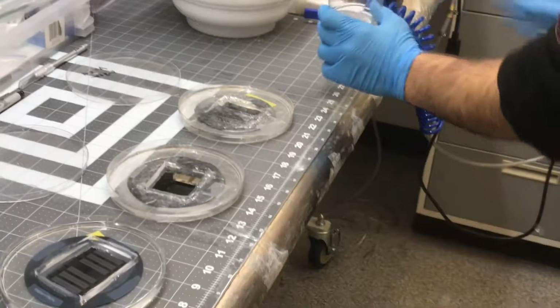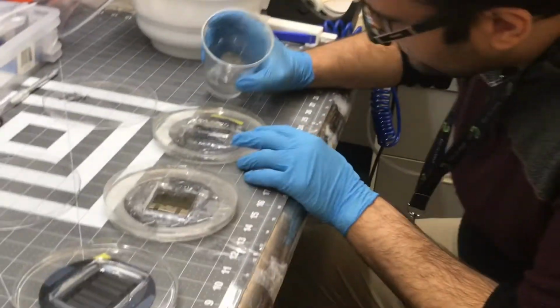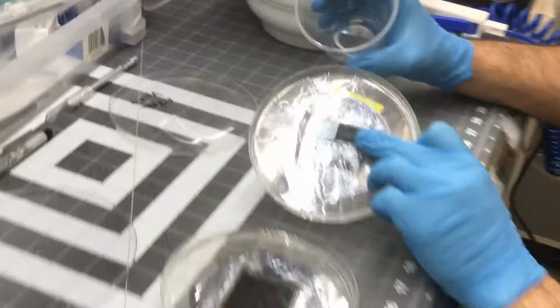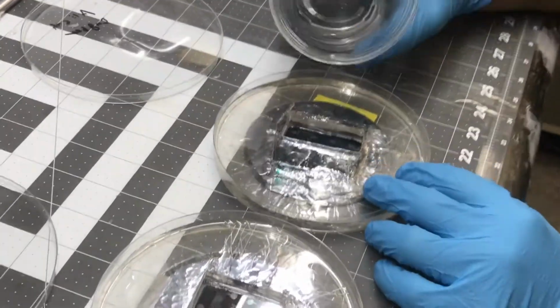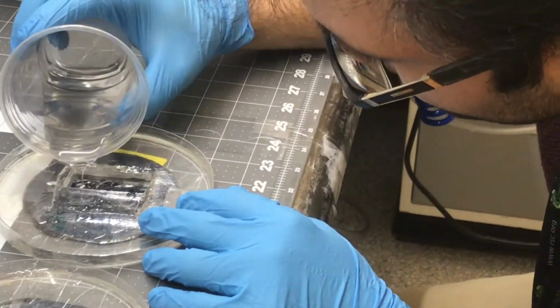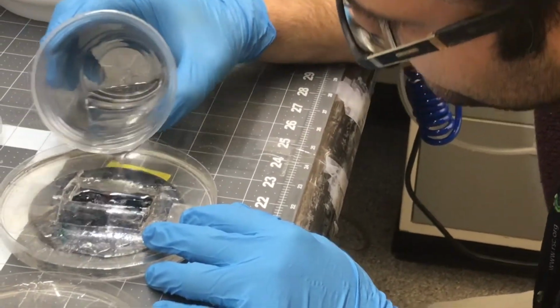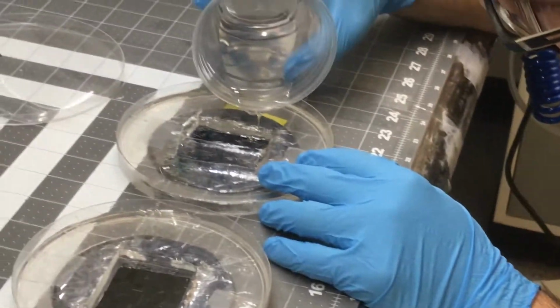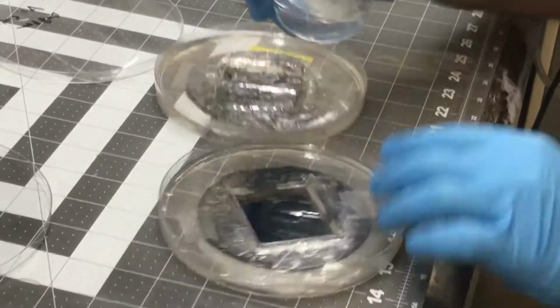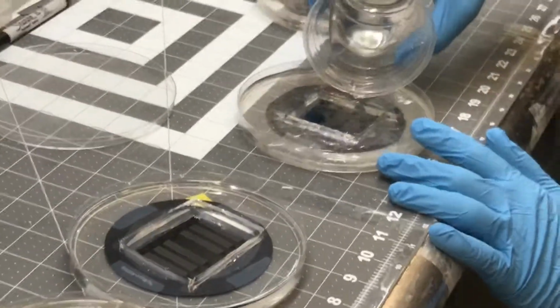As you can see here, you have to control spilling. So when you add, be careful that there is no particle here. It should be absolutely free from particles. Now Ali is adding it. Add not only in the center but over the whole area, because if you add only in the center, it cannot spread completely.